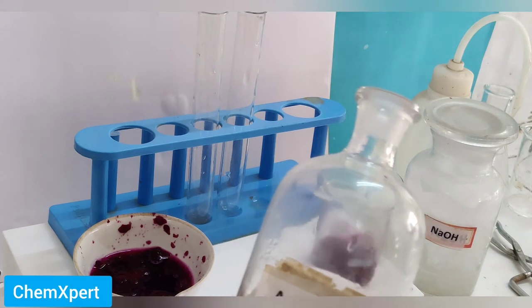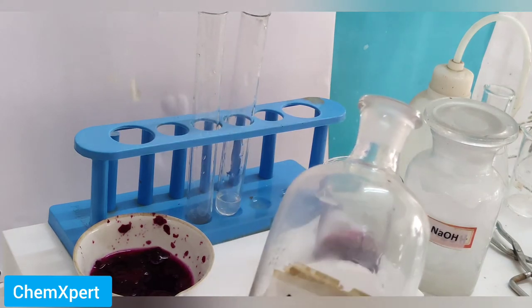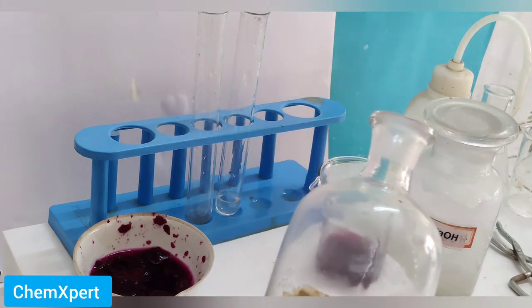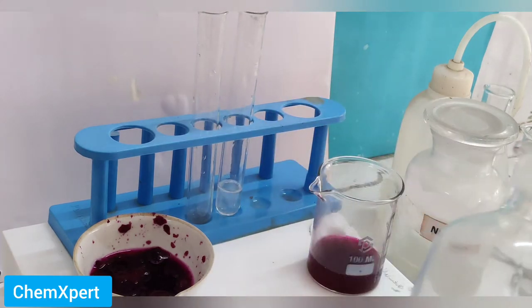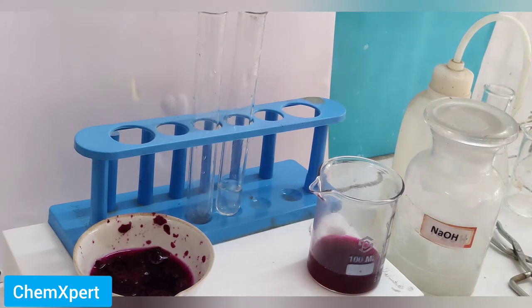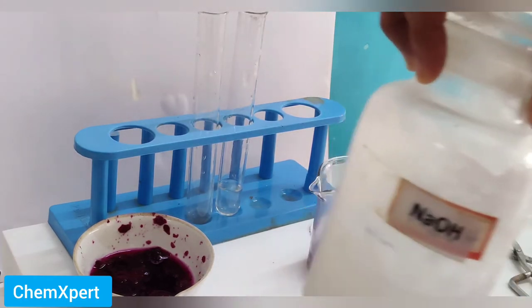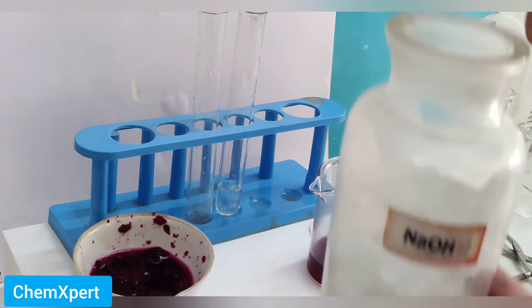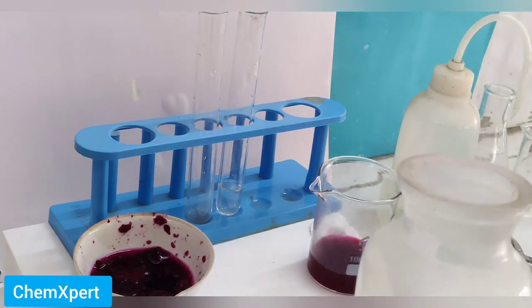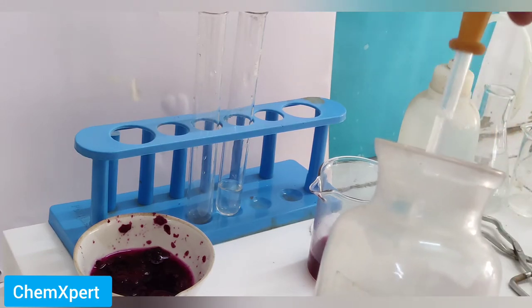At home you can perform the same activity by taking different samples. For example, here I am taking acetic acid as an acid — at home you can take vinegar or lemon juice. Similarly, for a base, here I am taking sodium hydroxide. At home you can use a soap solution or a baking powder solution.